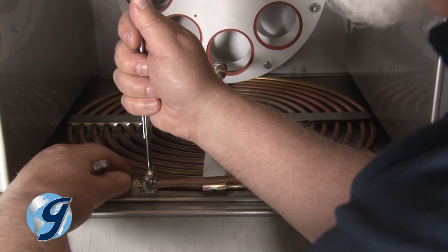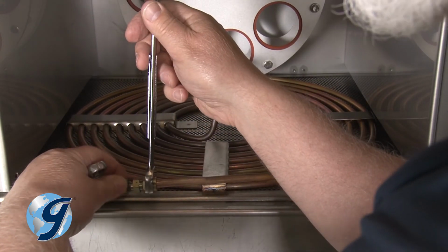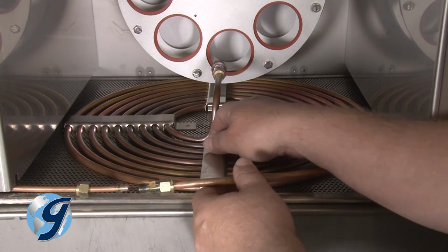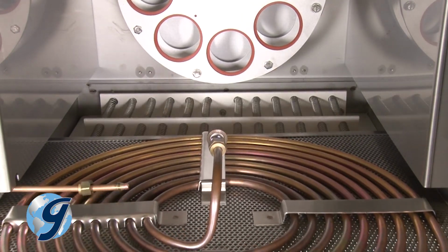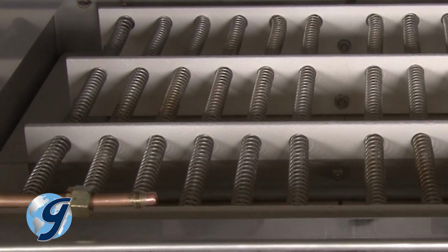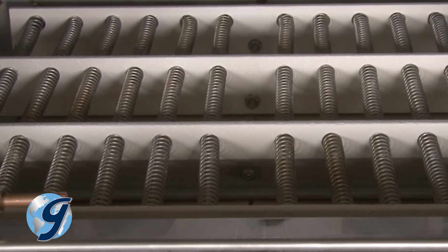Now, remove the air coil and tray by disconnecting the air line at its coupling. Next, remove the retaining screw and then slide the air coil and tray out of the unit. Carefully inspect the heating coils for any breaks.